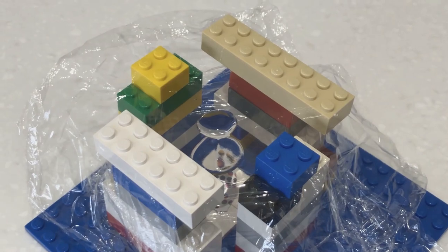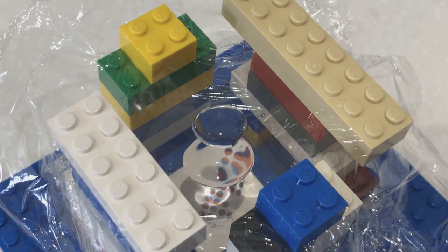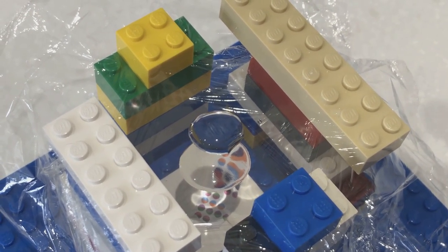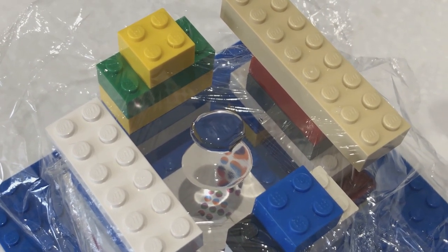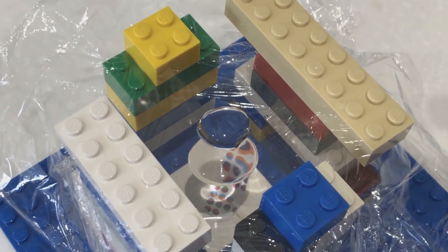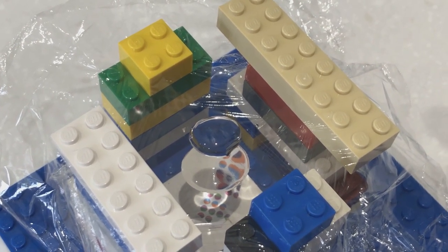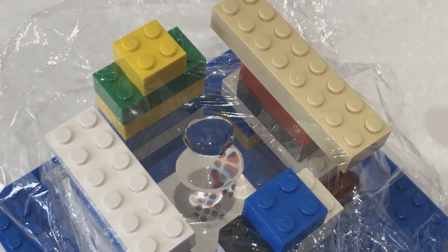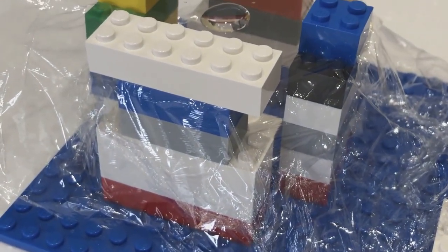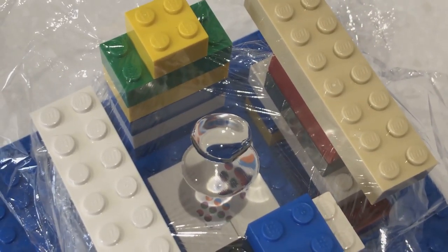You can experiment with the design of your microscope. In this particular case, I've placed a second water lens directly above the first water lens. So our microscope now has two lenses. This forms a compound microscope. Most modern microscopes these days are compound microscopes. You can experiment with the amount of water that you place in your lens and the distance between them. You can also exchange the water for oil. It may give you a different effect. In this particular case, I have two Lego bricks followed by our cling film, followed by our water lens that is placed directly above the first lens.